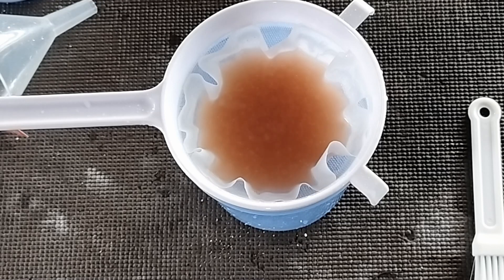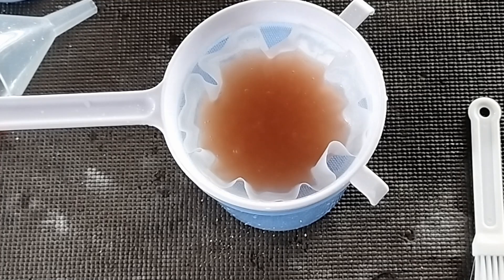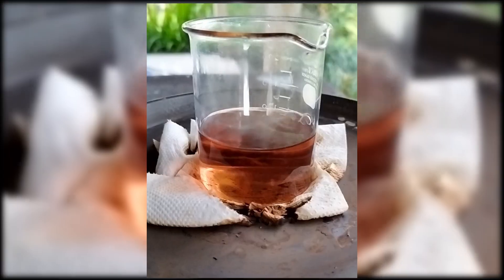It seems we have another carbonate monster in the filter paper. I think I should make a video on this because I've noticed this phenomenon with aluminum salts as well. The next step involves heating the mixture just under the boiling point of water to get rid of the iron nitrate, which decomposes at around the boiling point of water if oxygen is present.